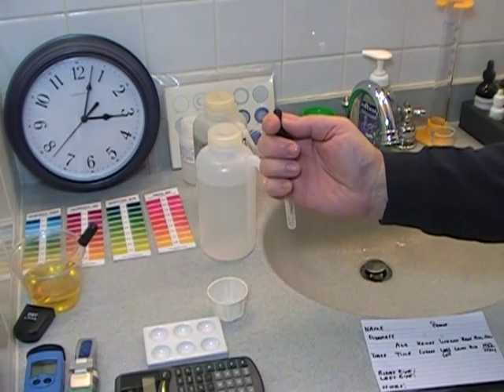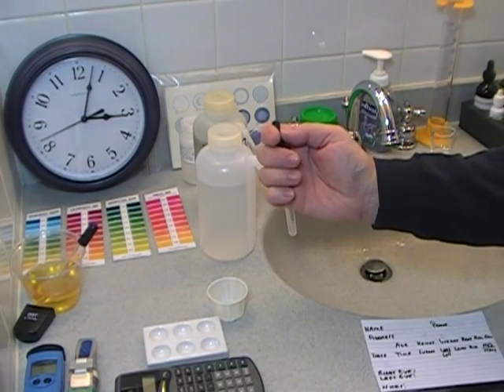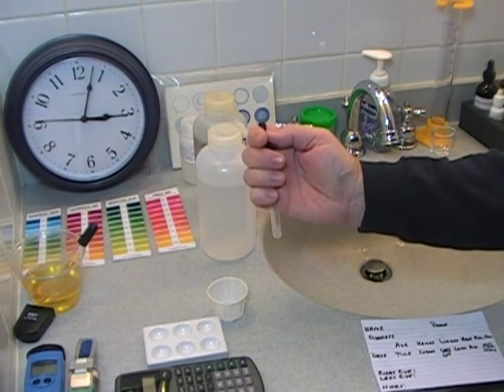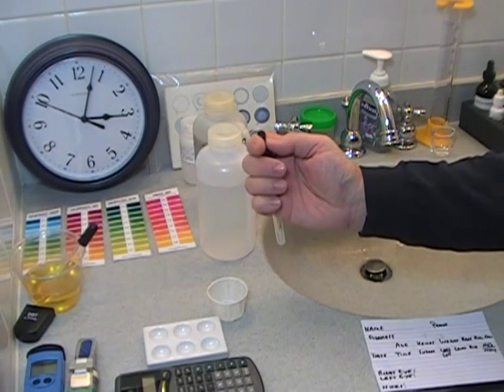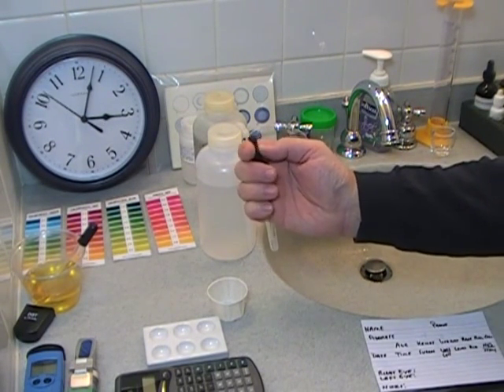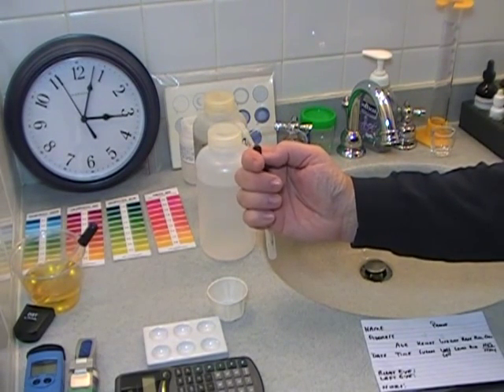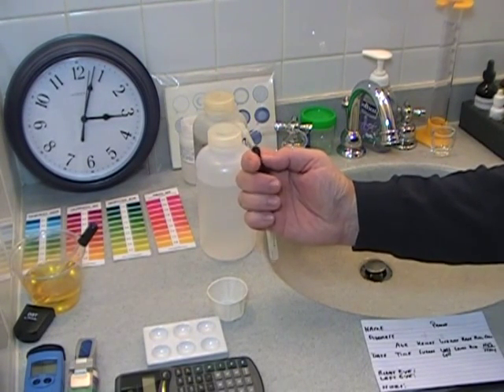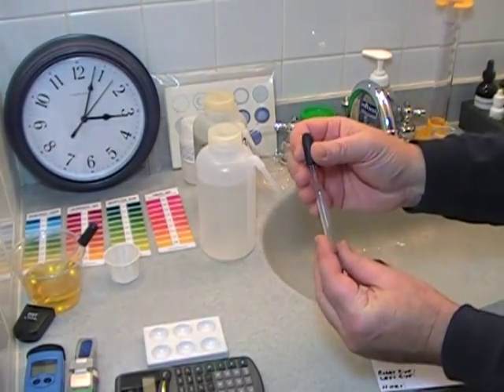You may hold it with one hand as well, whatever is easiest. Sixty seconds is up — that was much more than 120 times.